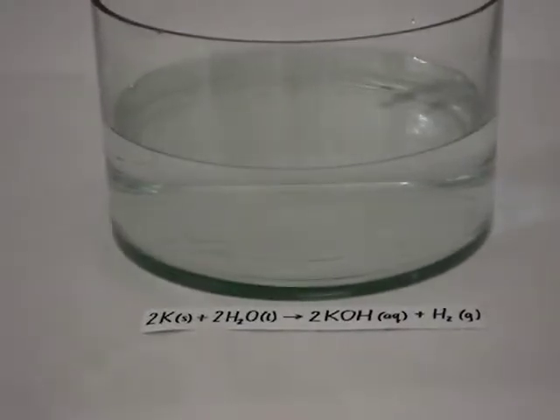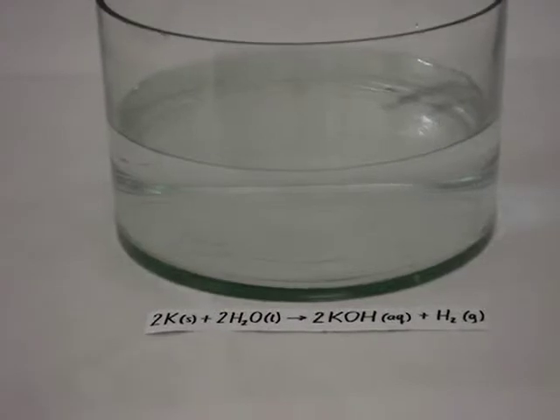And like sodium, it reacts with water to produce a base, this time potassium hydroxide and hydrogen. We're going to view that.